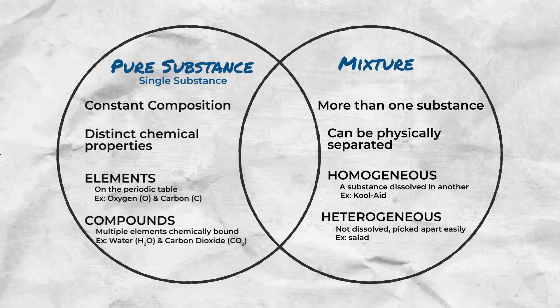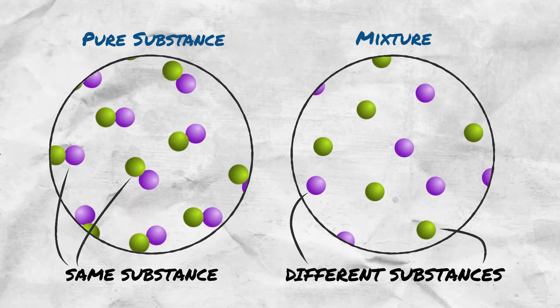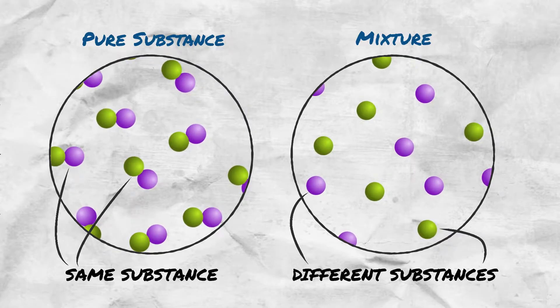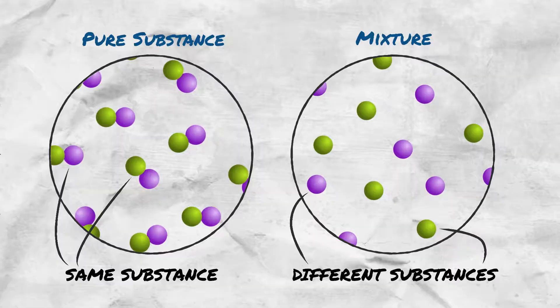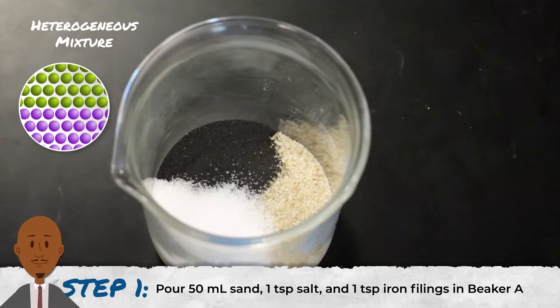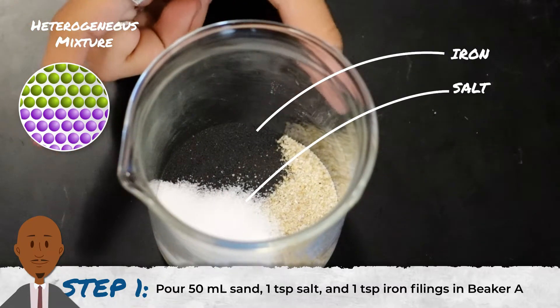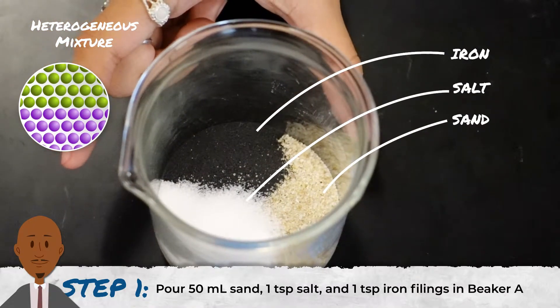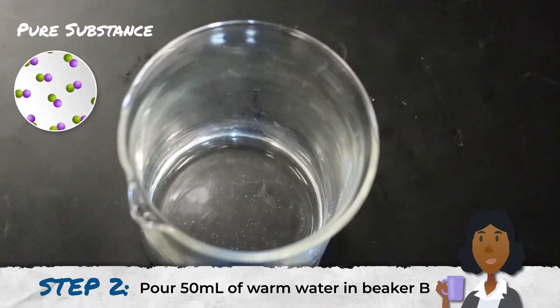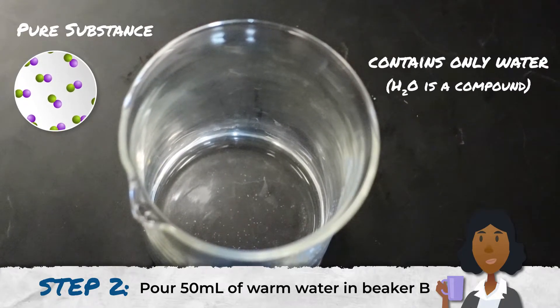Heterogeneous mixtures contain substances that do not dissolve and can be picked apart easily, such as salad. In this lab we will create different mixtures and separate them as much as possible. Beaker A is a heterogeneous mixture because it contains iron filings, salt, and sand, which are not dissolved. Beaker B is a pure substance because it contains water, and water is a compound.